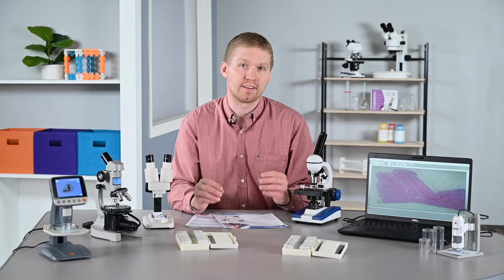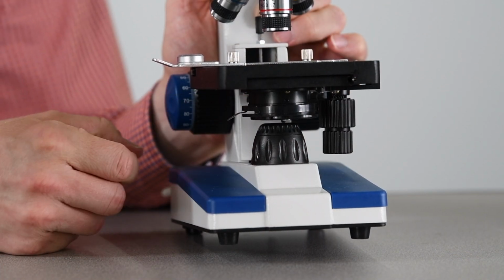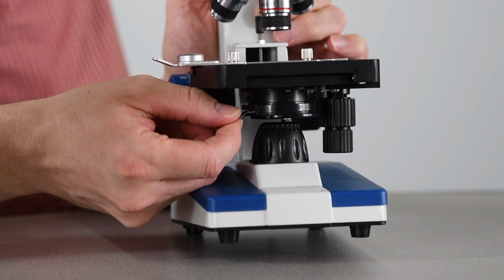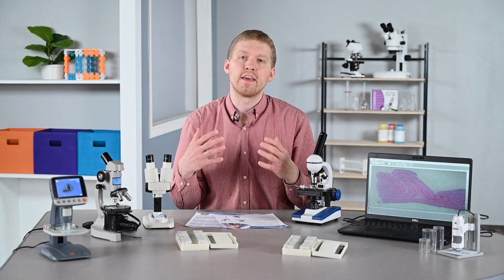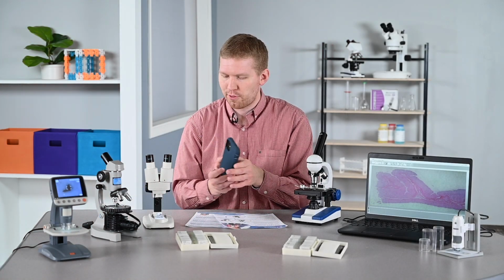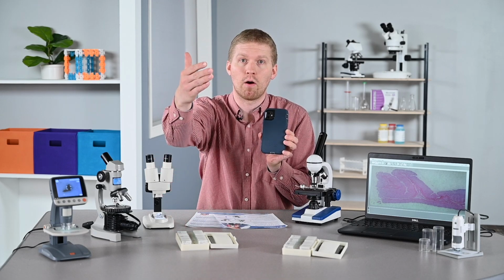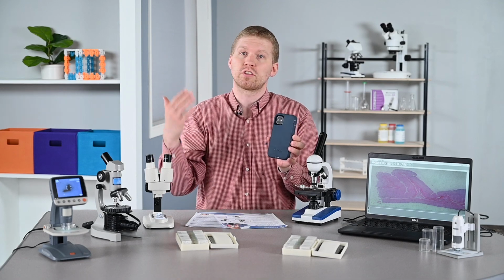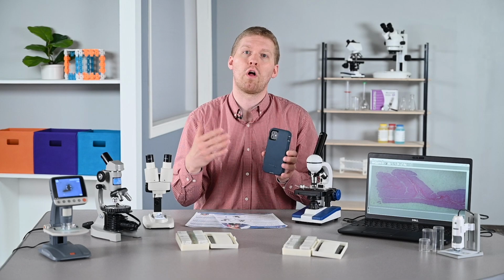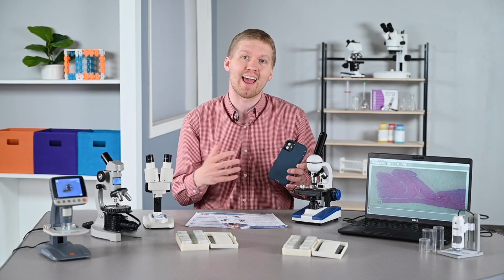If you're wondering, the condenser and diaphragm are located below the stage, and they help control how much light is passing through the object you're viewing, which also helps regulate contrast. Think of it like this. You're outside with your phone, you're taking a picture, but you have the sun in the background and it's coming right at your lens. It's going to affect your picture, right? So just like with any microscope, you want to control how much light and the angle of light coming up so you have a better focus and a clearer image.